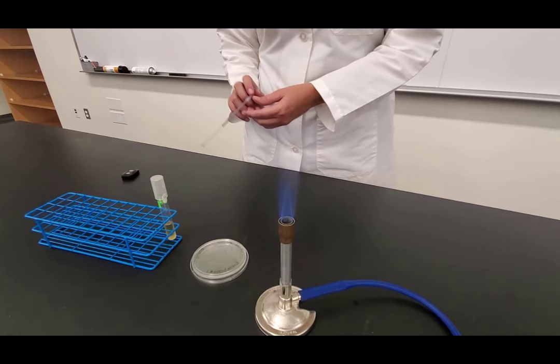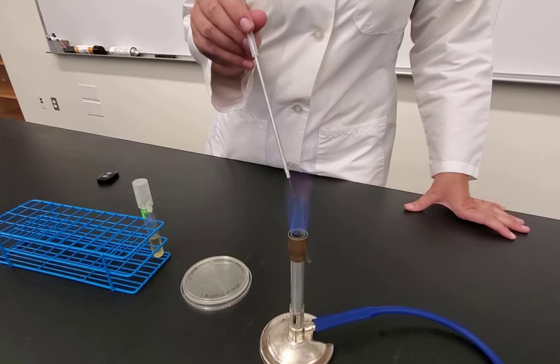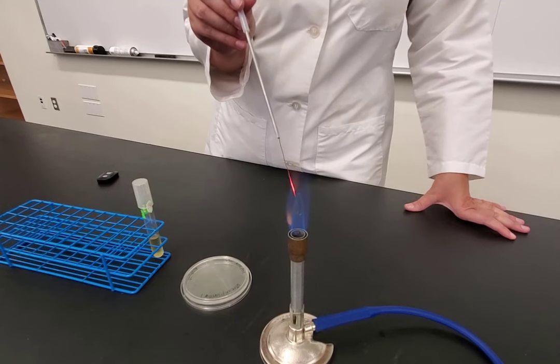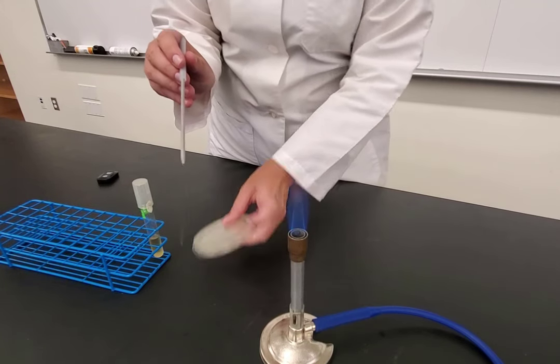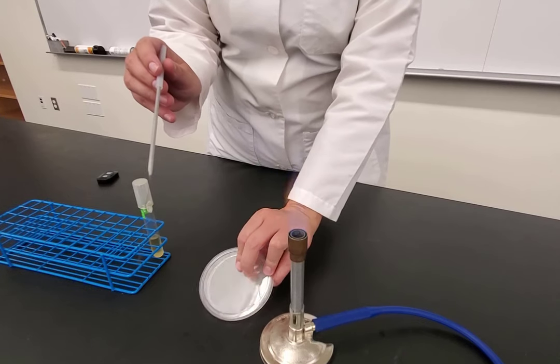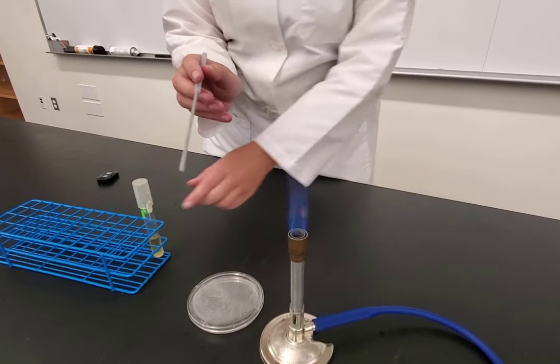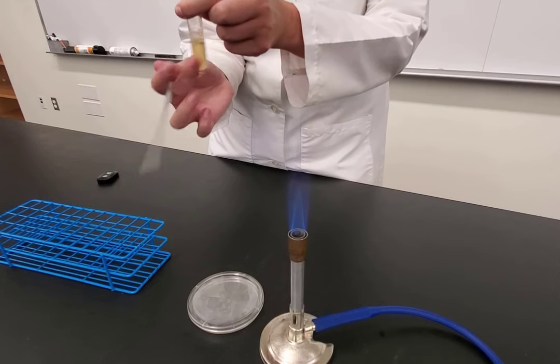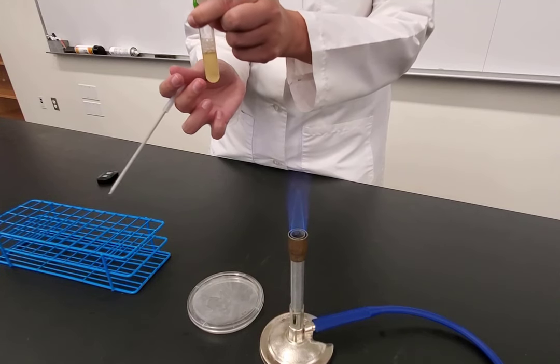In the video demonstration: the Bunsen burner is lit with a blue inner cone — the hottest part of the flame. Working with the plate close to the flame as the sterile field, flame the loop starting at the base working towards the loop itself. The plate is kept agar side up to start, keeping condensation on the bottom. There is a little line on the top of the plate to help guide where quadrant one is.